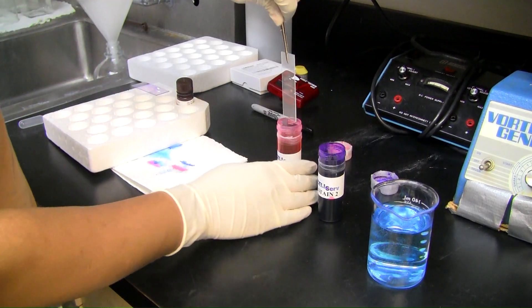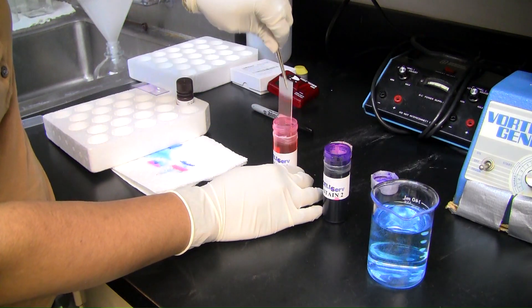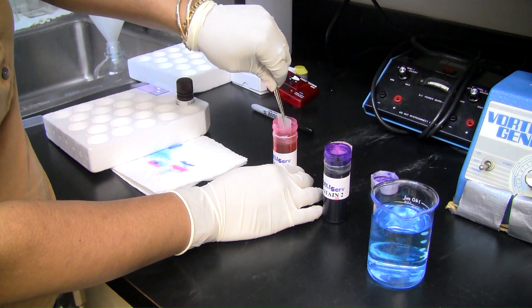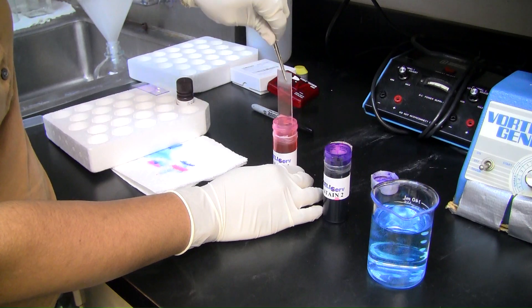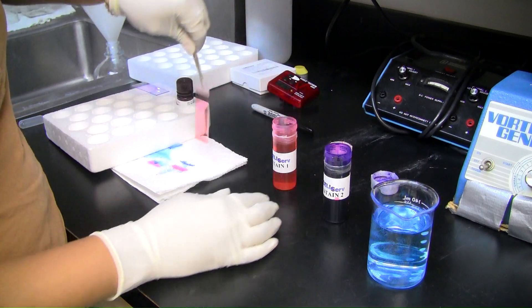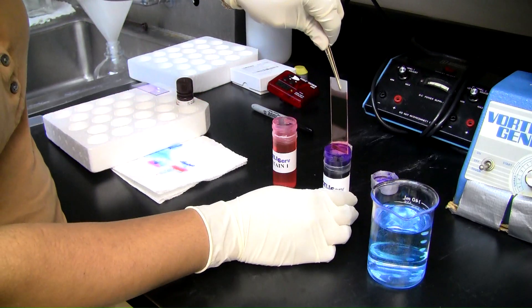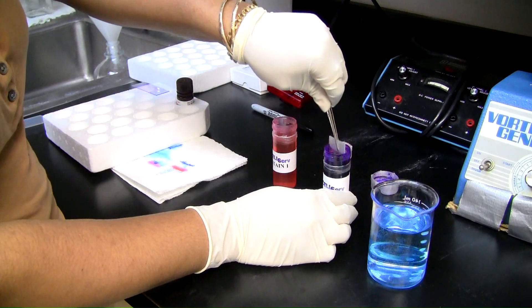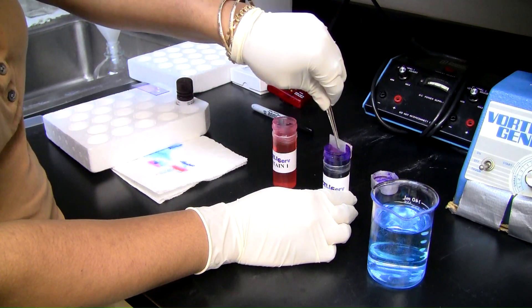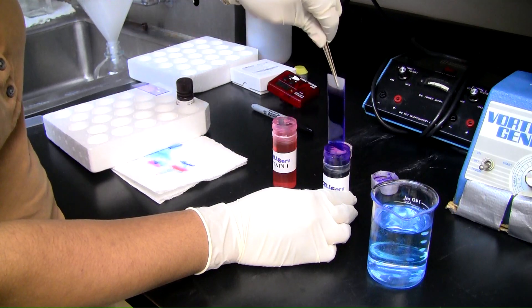Once the slide is dry, dip the slide into stain one three to five times. Dab the bottom of the slide on a paper towel. Next, dip the slide into stain two three to five times. Dab the bottom of the slide on a paper towel.